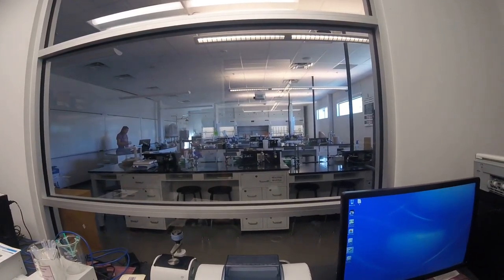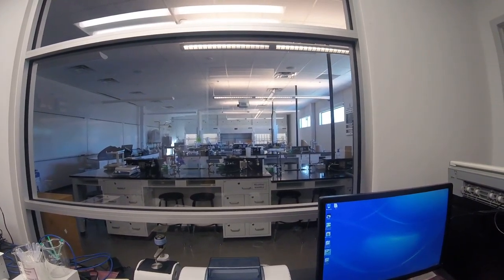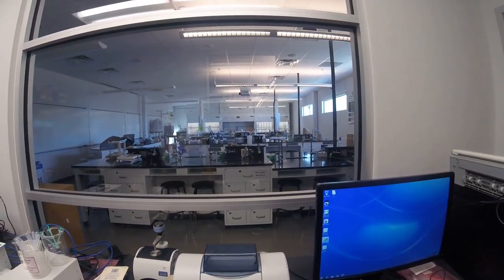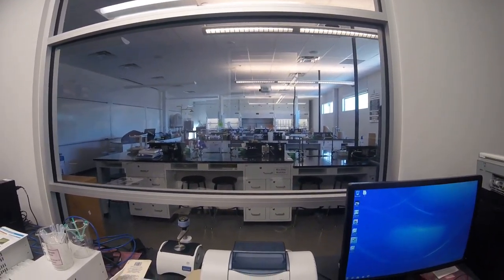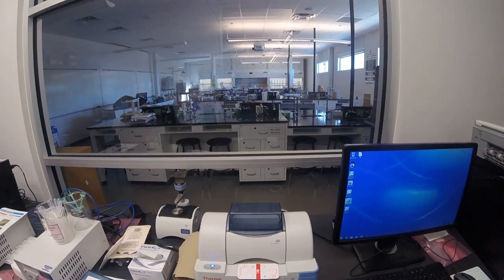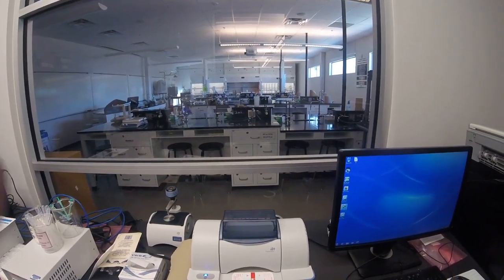Hello, this is Clarissa Sorensen Unruh, and I'm doing an IR today. So we're doing a demonstration for an IR. This is the IR. It's a lovely machine.